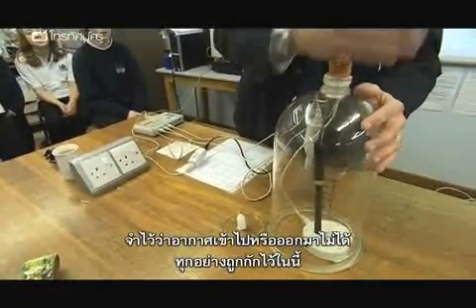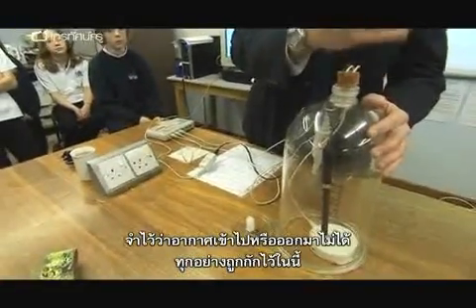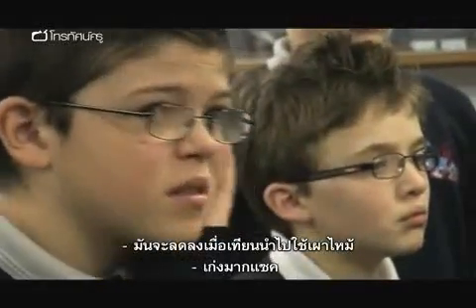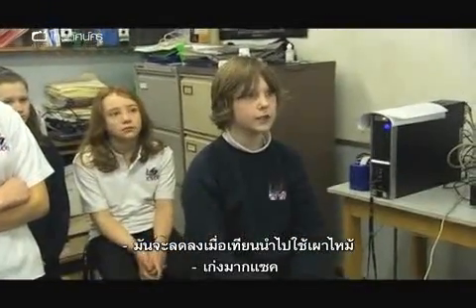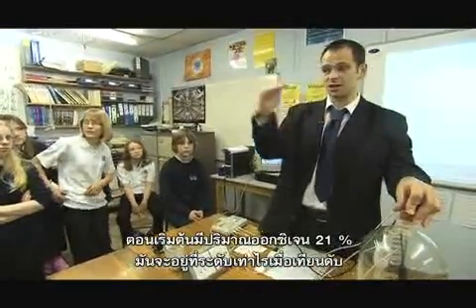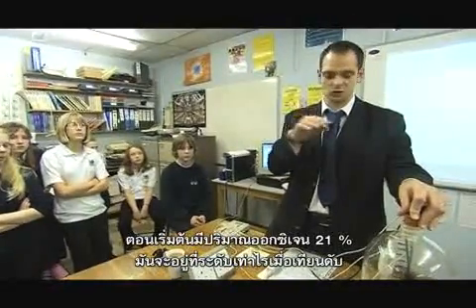Bearing in mind, no air can go in and no air can go out. What's in here stays in here. Or decreases, the candle burns it up. Well done, Zach. Okay. So at what level, in terms of percentage, we start at 21%, when do you think the candle will go out? 15. Okay, that's a good guess. I like that.